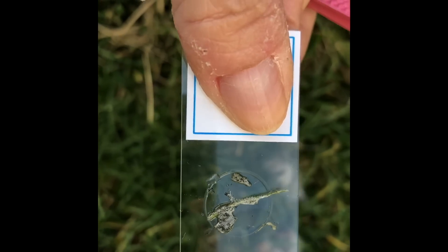It's not working quite as easily as I thought it would. I need both hands to do that — okay, got it. I don't know what I've found, but I've never seen this before and I don't know what it is, so I'll show you. I can see some neon glowing color when I use my UV light, but not fibers — I don't see fibers. I see tiny tiny balls. That makes me wonder: are they red blood cells? I don't know, I'll show you.